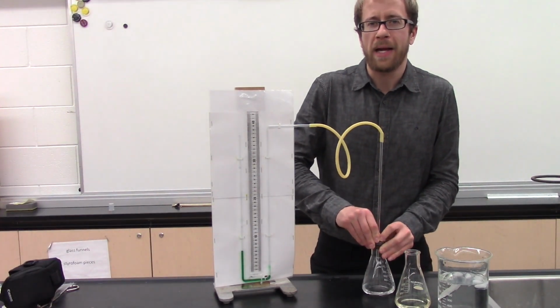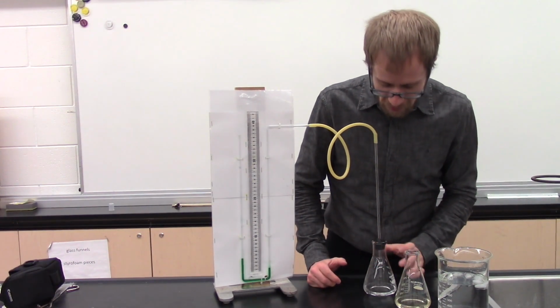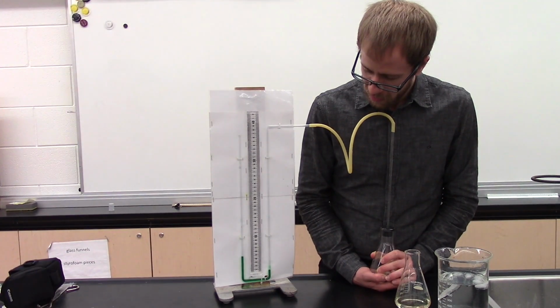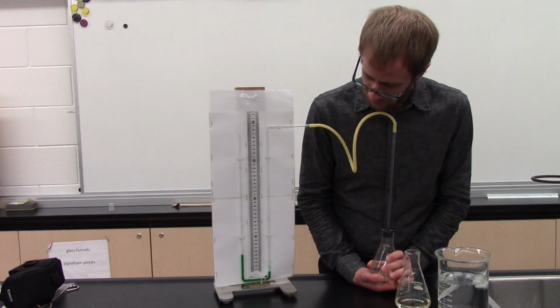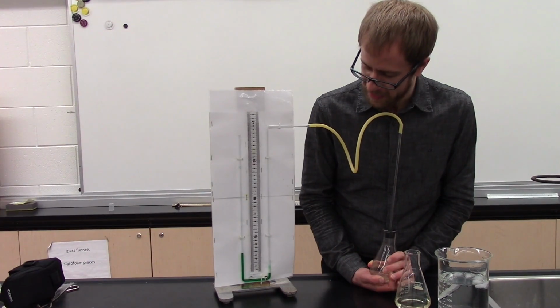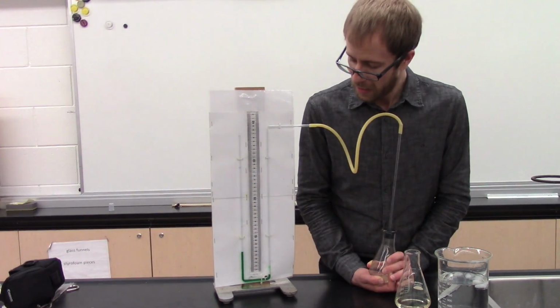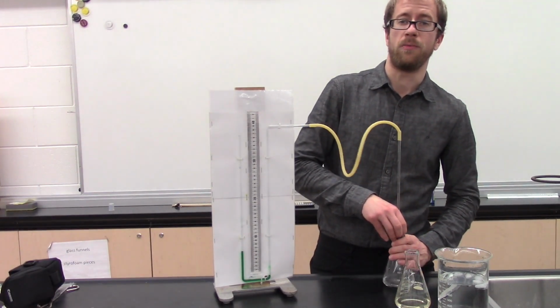Now, what do you think would happen if I heated this water up? What would happen if I took this and I held on to it for a little while? What do you think would happen to the vapor pressure? Now, it's fairly subtle. You might not be able to see it on the camera, but it is slowly rising. The longer I hold this, the more it will rise to a point where it reaches equilibrium again. So it is slowly rising. Now let's try out the acetone.